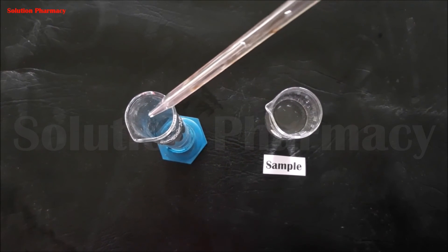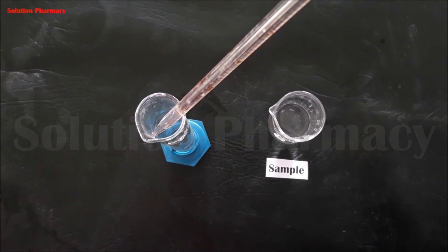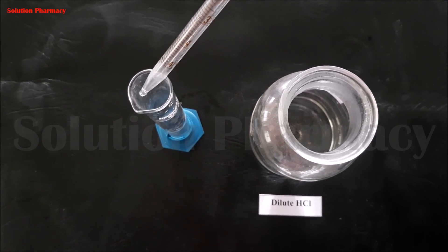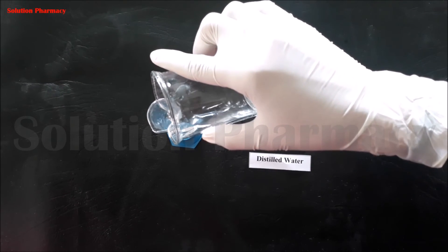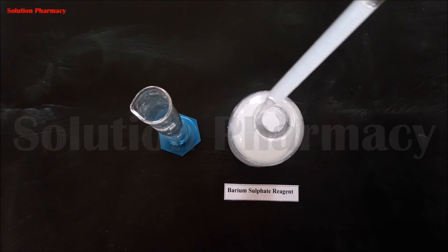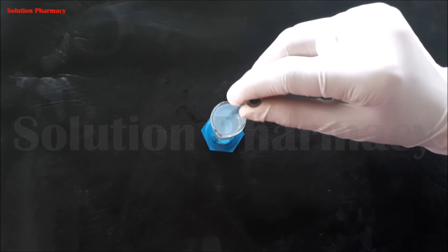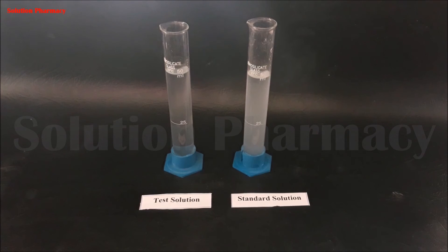For the test solution, take another clean and dry Nessler cylinder and transfer 1 ml of the sample solution. Follow the same procedure: add 2 ml of dilute HCl, dilute up to 45 ml with distilled water, add 5 ml of barium sulfate reagent, and mix the contents of the Nessler cylinder with a glass rod. After mixing properly, keep the Nessler cylinder aside for 5 minutes.